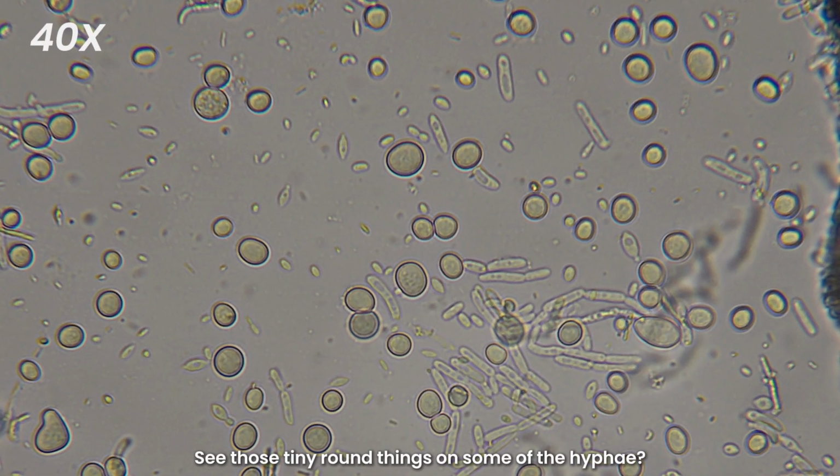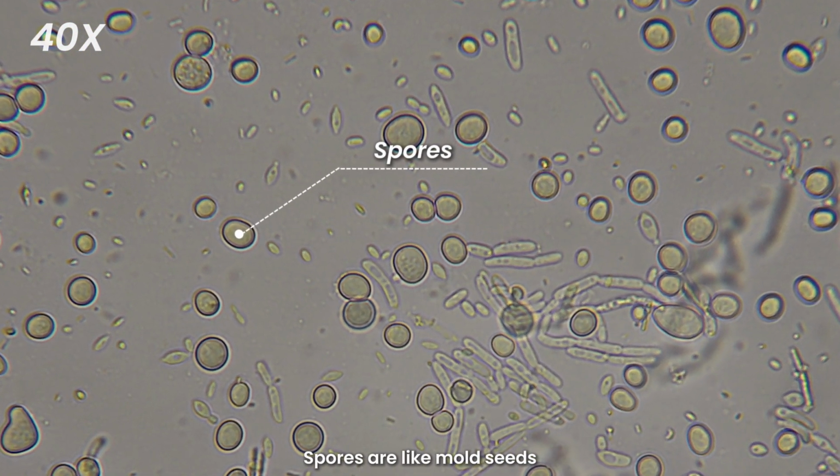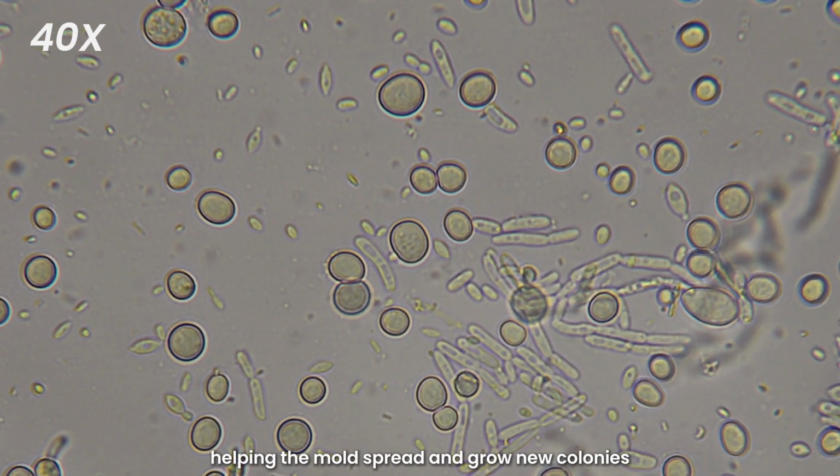See those tiny round things on some of the hyphae? Those are spores. Spores are like mold seeds. They float in the air and can land on other food sources, helping the mold spread and grow new colonies.